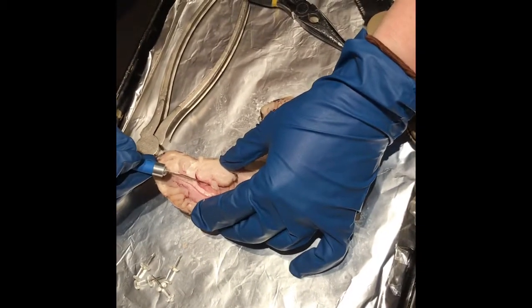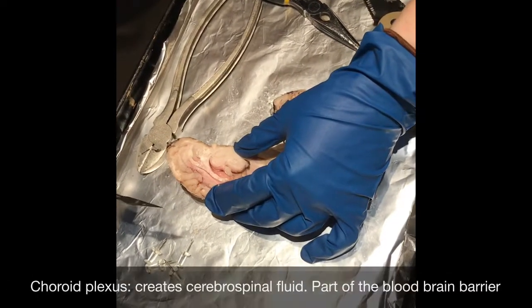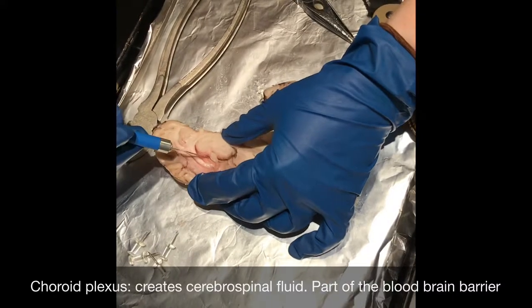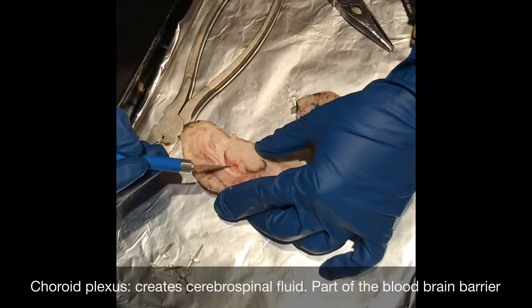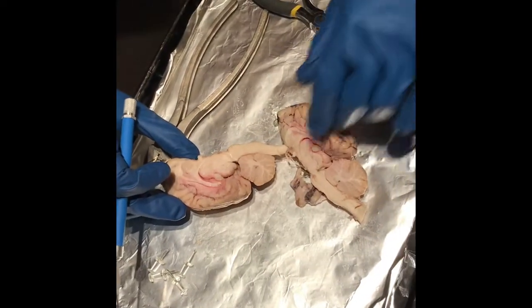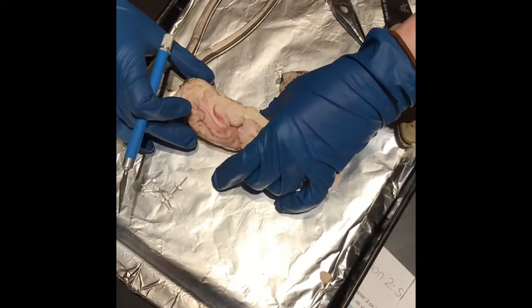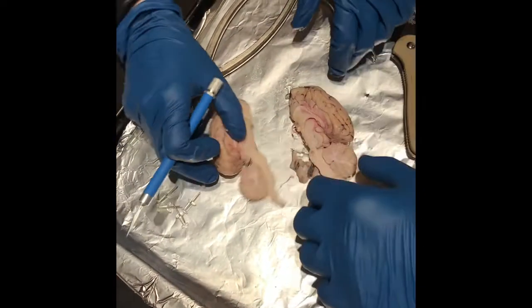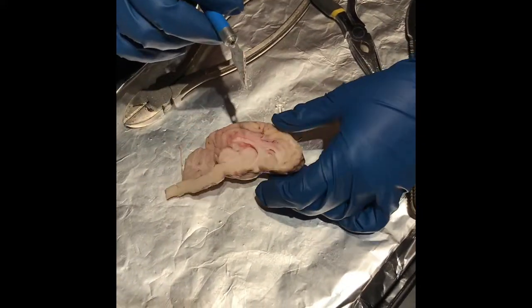And the function for that is that it carries signals from the hippocampus to other parts of the brain. Yes. And the lateral ventricle has choroid plexus in it, which is kind of this little pinkish, squishy part. That's why some pharmacological items do not pass through into your brain, and some do. Yes. Optic chiasm we previously identified, there's part of it right there.